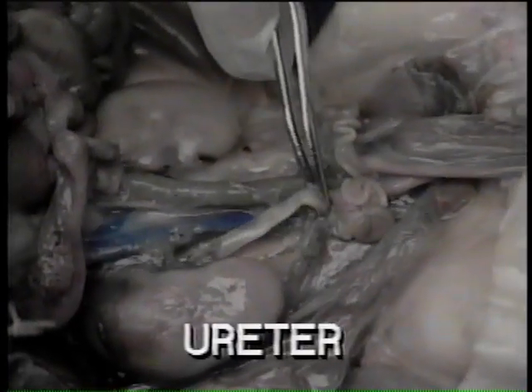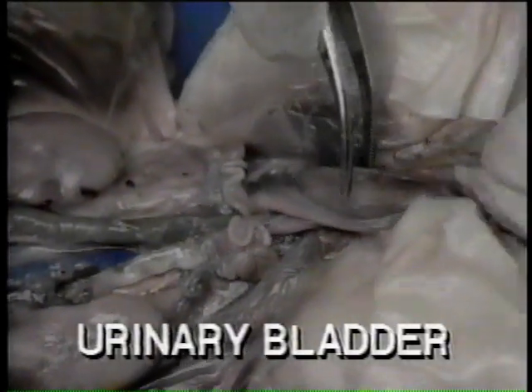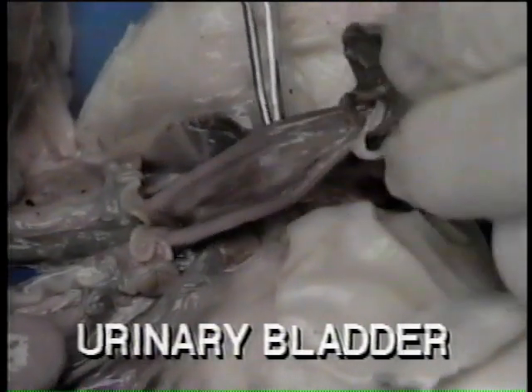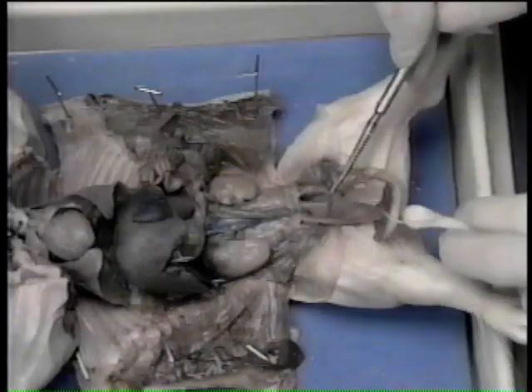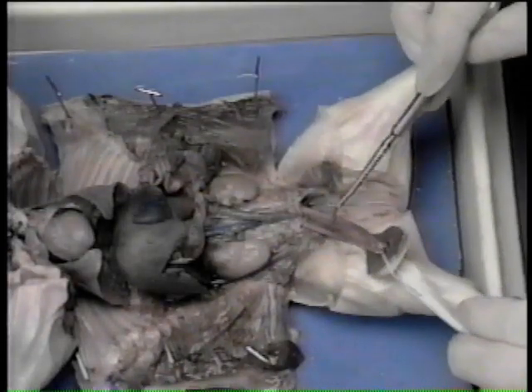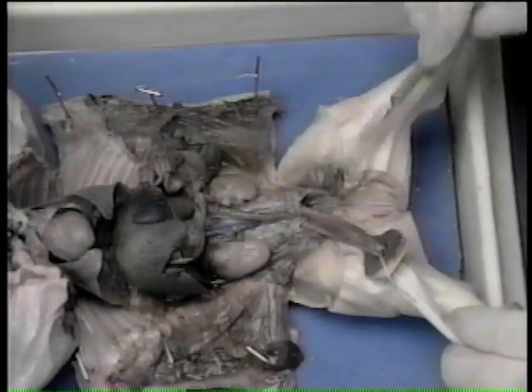Emerging from the kidneys is the ureter, which empties urine into the urinary bladder. The bladder is an elongated sac lying between the two large blood vessels known as the umbilical arteries. The bladder continues into the umbilical cord. Proceeding from the urinary bladder is the urethra.